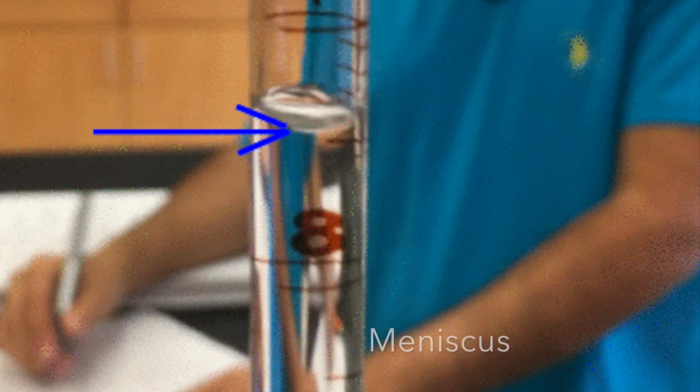So that's right. When adding a liquid to a pipette, a curved surface at the top of the liquid will occur. This is called the meniscus. The meniscus occurs due to surface tension. When the particles of a liquid are more strongly attached to the container than to each other, this causes the liquid to climb the walls of the container.